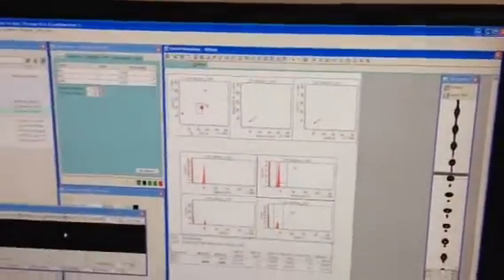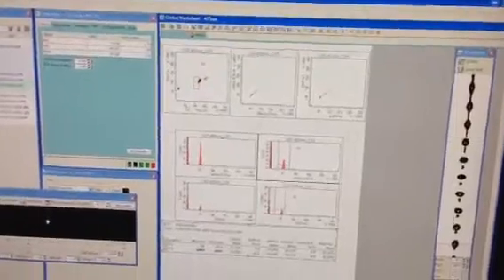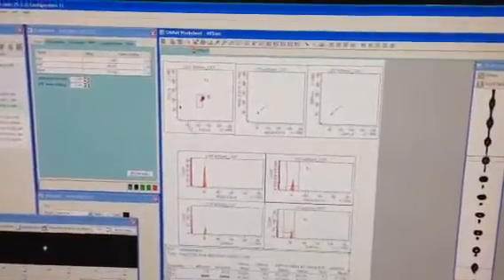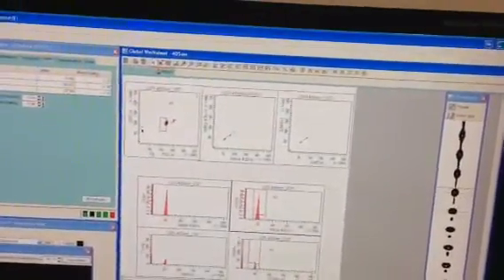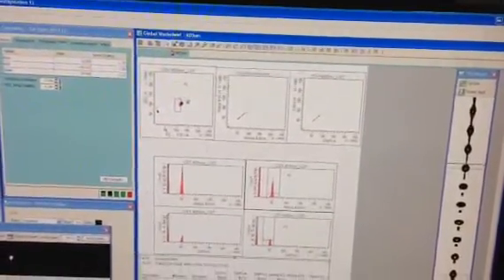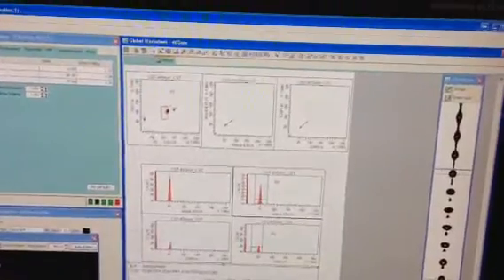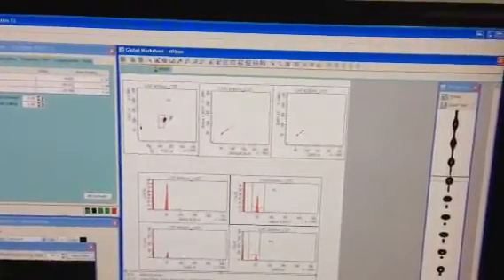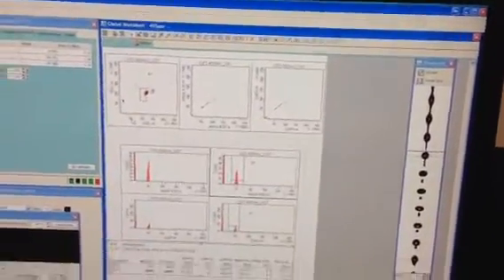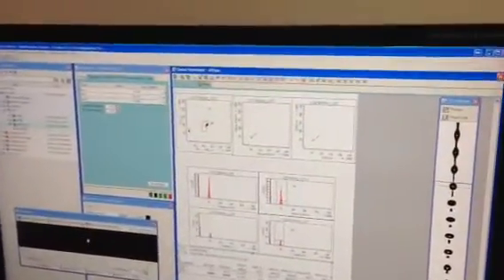And the depth of focus really just affects the laser for the signal strength. So it's how well focused the laser is on the interrogation point. Generally, we don't have to change that very much. It's usually an issue of the sweep. So the front one, and the one that's pointing up, that we can see from the front, and the one that's pointing away from you, inside of the machine. The two of those will usually get you to the point that everything is tightened up.